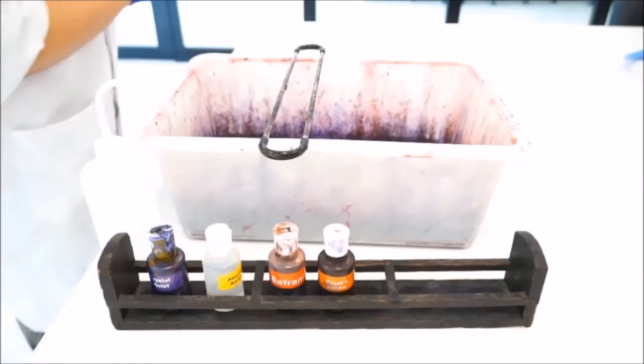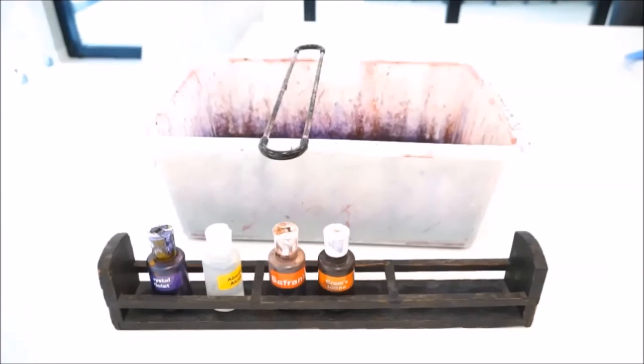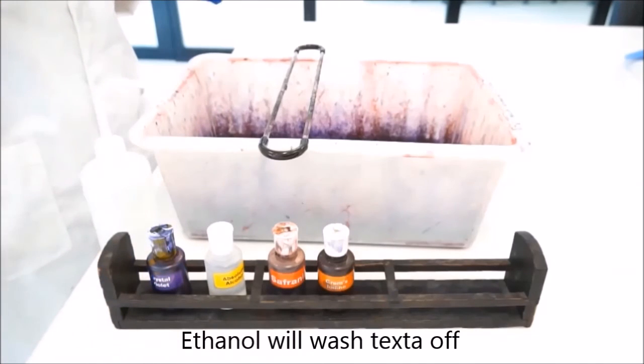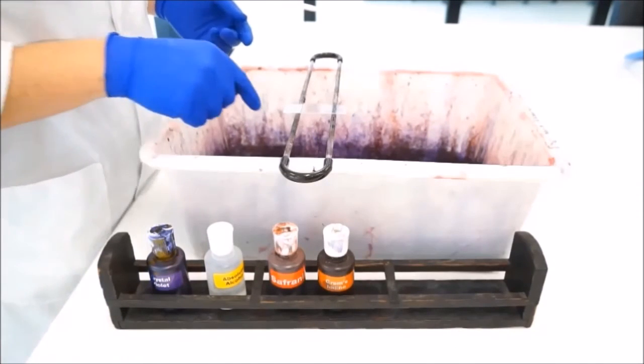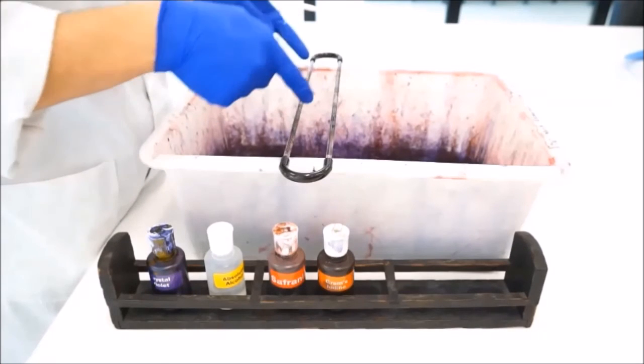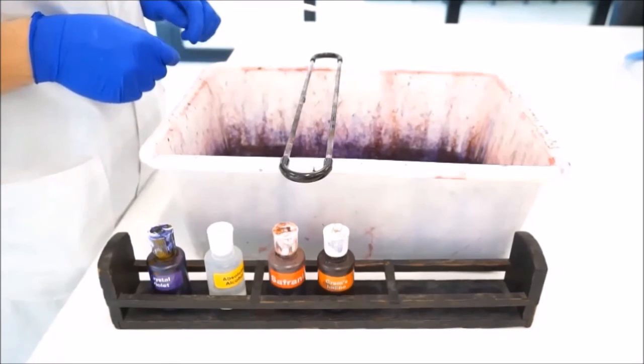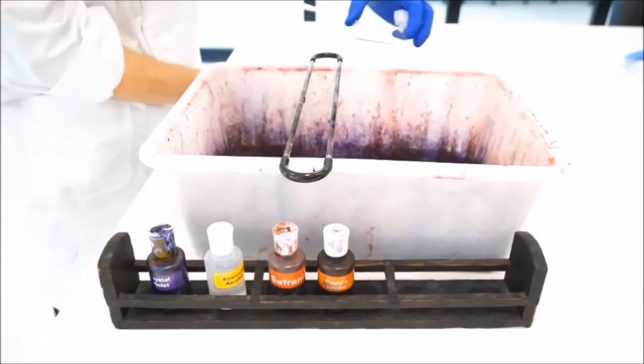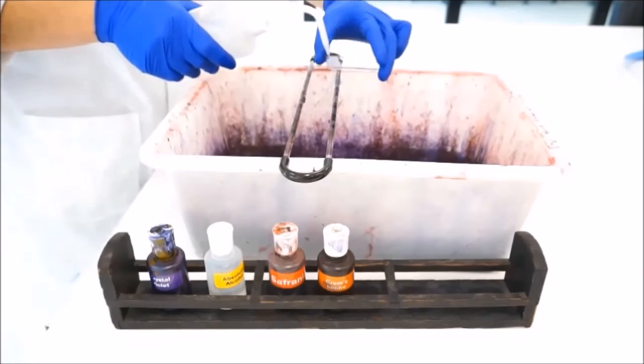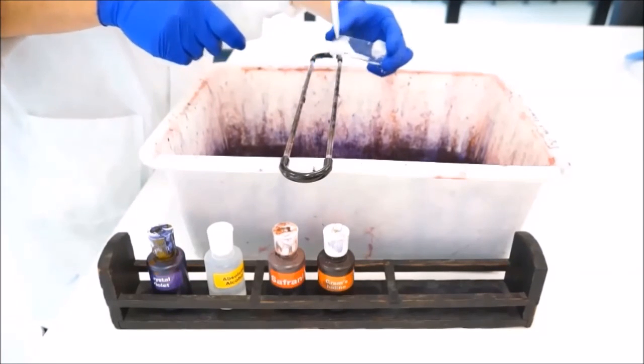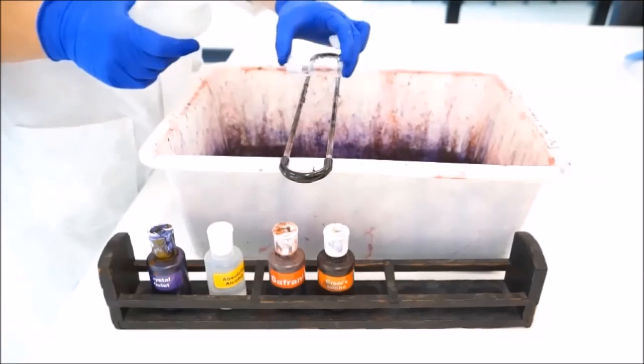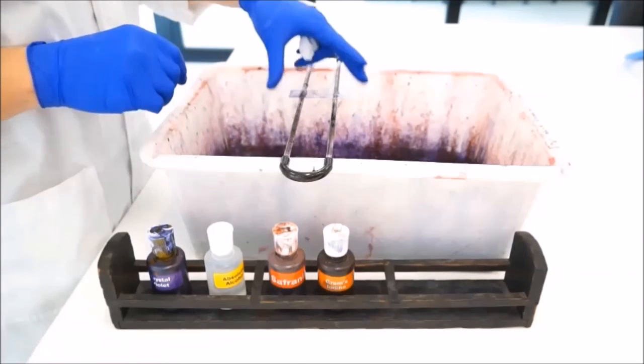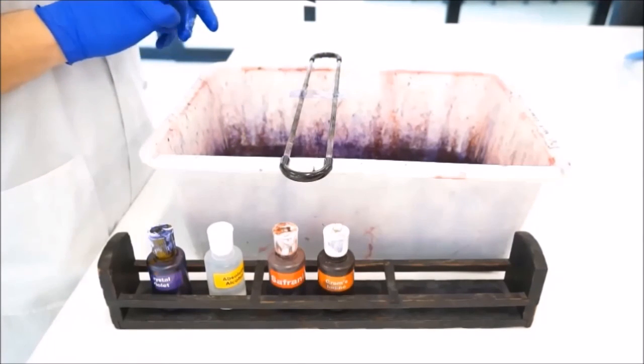Just remember, if you are marking these with markers to identify them, the ethanol will wash the marker off, so you'll need to identify them in a different way. If you do accidentally knock your slide into the liquid - there's going to be a lot of liquid waste - I'd just get my gloved hand in there and pull it out. Give it a quick rinse with your water and simply keep going with the Gram stain. Because this staining technique is just so robust and so well tolerated that that should still work.